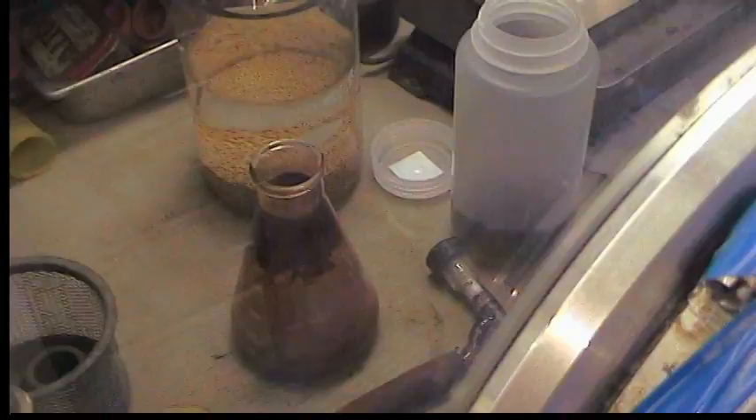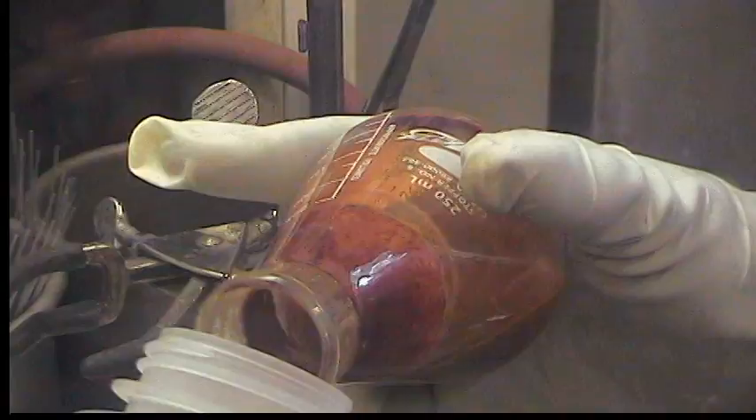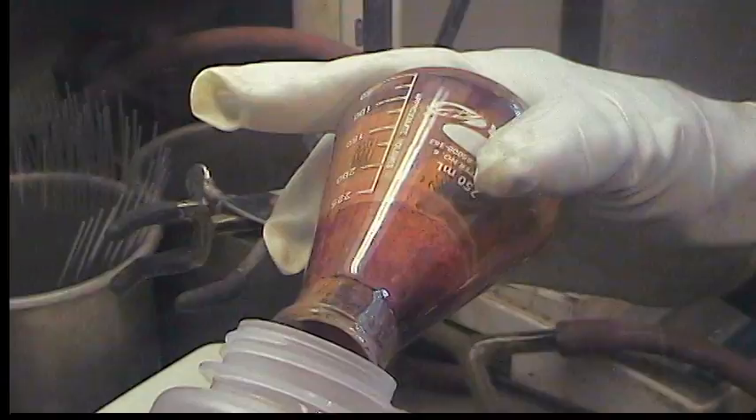Give it another minute, it will settle a bit more. So we have molybdenum in the plus 4 oxidation state now. The orange precipitate should be the tetrachloride. And tin dichloride is the expected tin-containing byproduct.